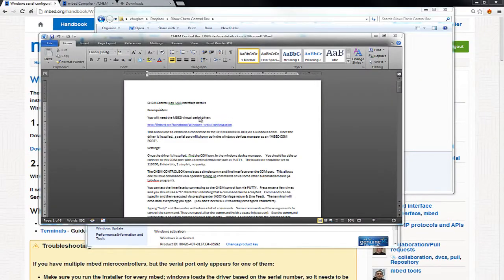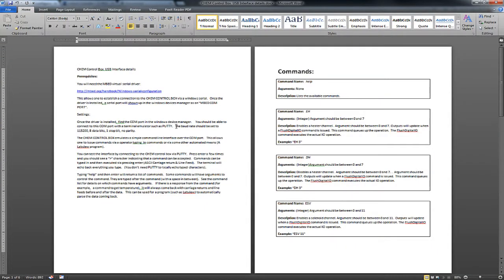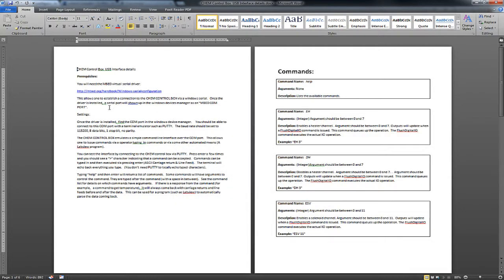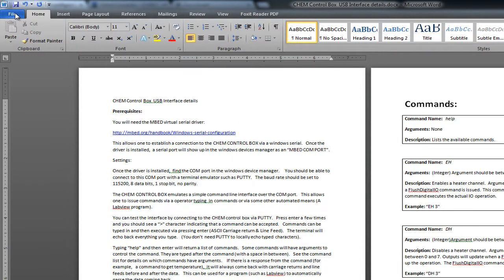So, in the Dropbox where I put all the documentation, there is a file called Chem Control Box USB Interface Details, and I open that up in Word. That tells you all about how this USB interface works. So I tell you to basically install the embed driver, and then it'll just show up.